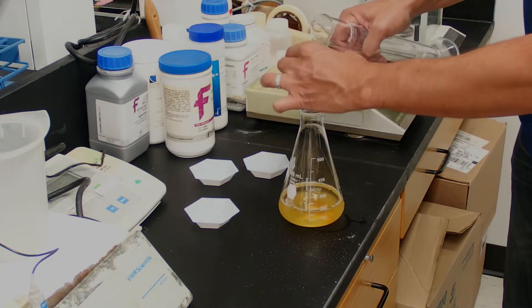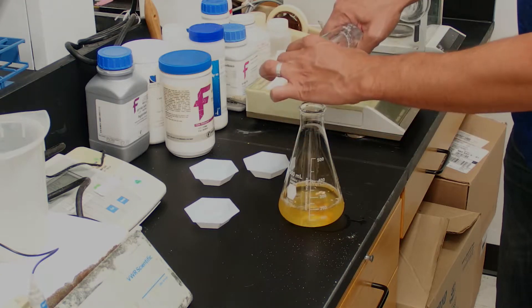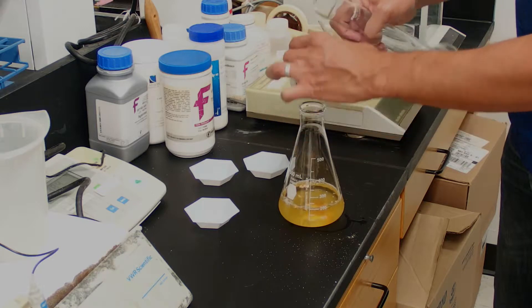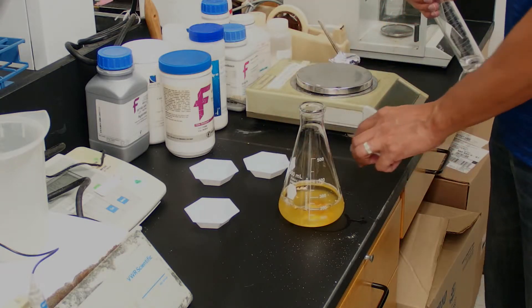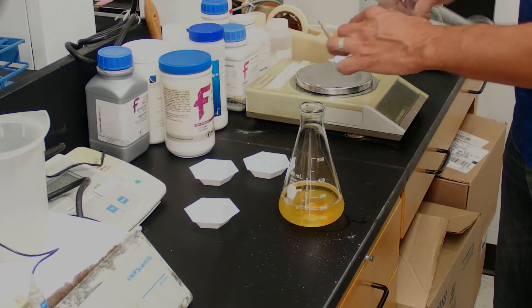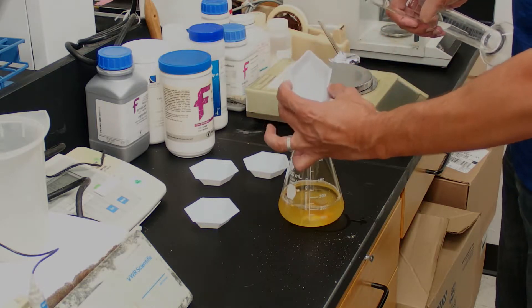So we're not bringing this to volume, so we'll probably end up with just ever so slightly over 200 milliliters because we have the volume of these solutes plus the water. It doesn't matter for LB agar.